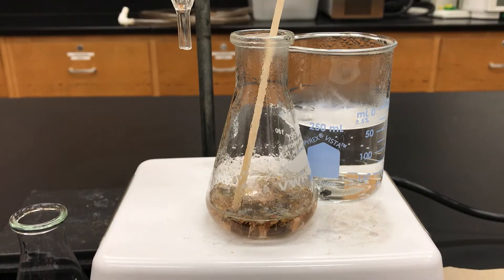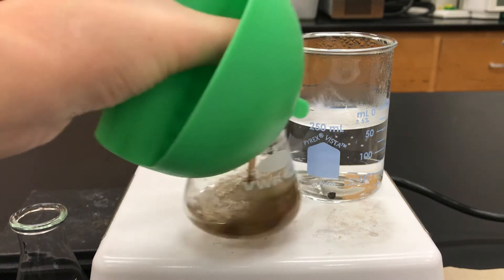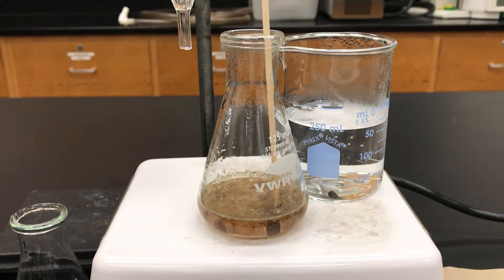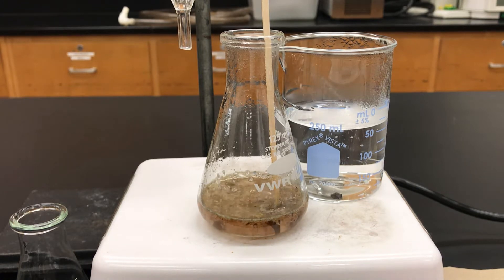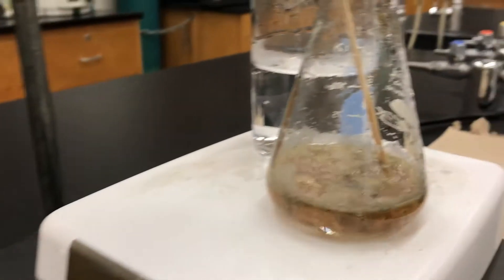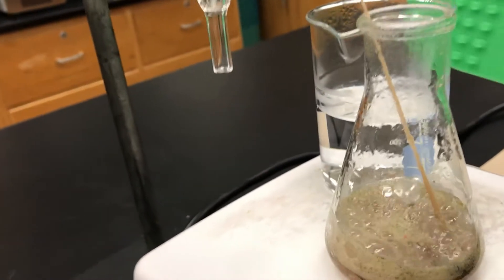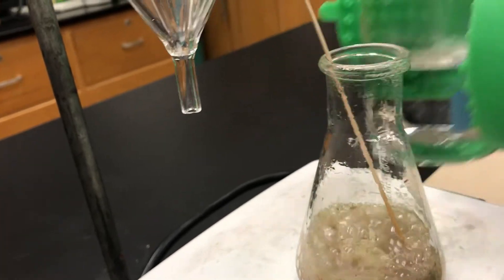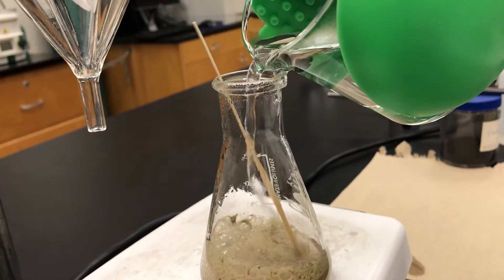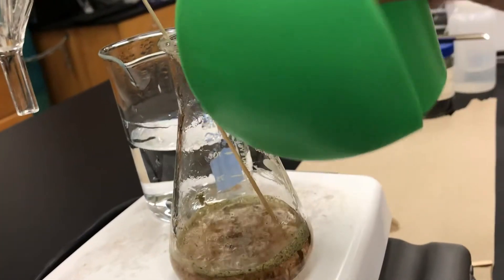After some time the water in the flask will start to boil and it may start dissolving the solid. You want to every once in a while swirl it around and see how it's going, but likely you're going to have to add more solvent. Our goal is to add the minimum amount of solvent — in this case water — that we need in order to get that solid to completely dissolve. Do you notice how it's still chunky? That means we need more solvent. Sometimes the solutions also foam quite a bit, so you do want to control the heat and you might need to turn it down if it gets too frothy. You'll add the solvent in portions until the solid completely dissolves.